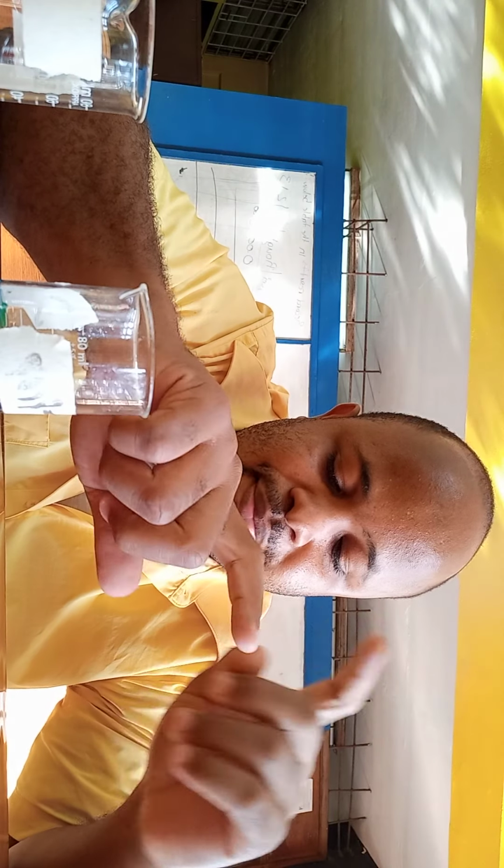So if you want to differentiate between primary and secondary alcohol, it's best to do a direct test, like the iodoform test, right? But for exam, you oxidize it and then you carry out a secondary test, meaning carry out a reaction for the carboxylic acid or the ketone, like Brady's reagent, 2,4-dinitrophenylhydrazine. So you could do that. But as we see in practice, it probably needs some adjustments to get a better differentiation between the two reactions. As you can see, test tube A, it's still going.